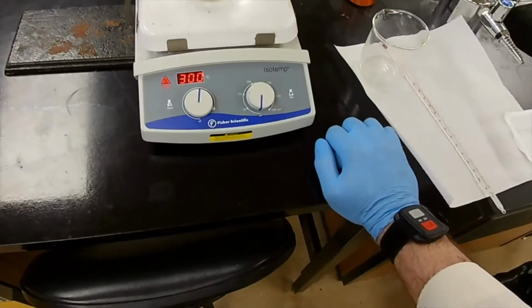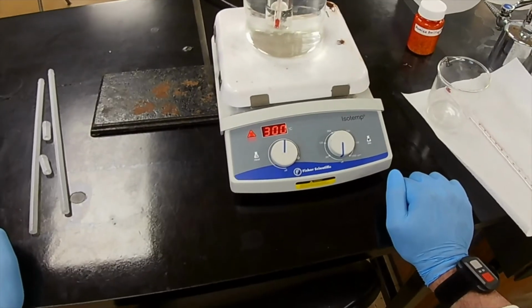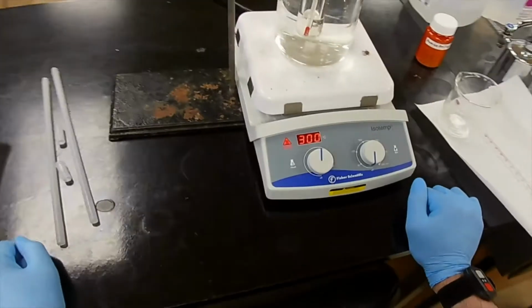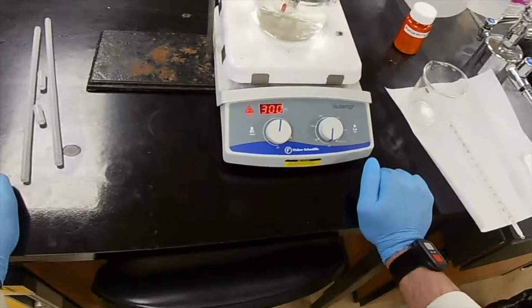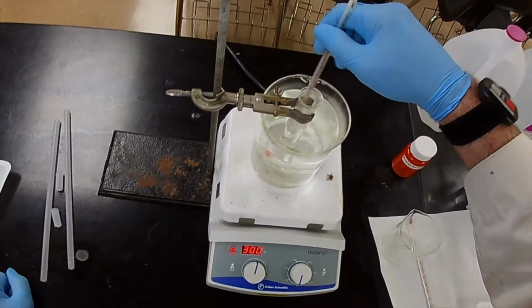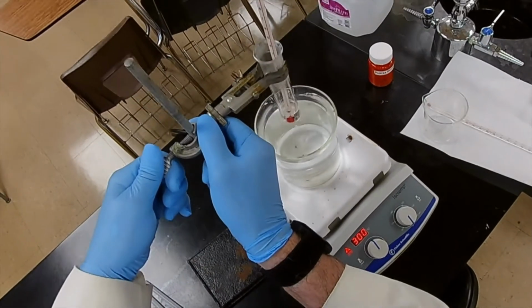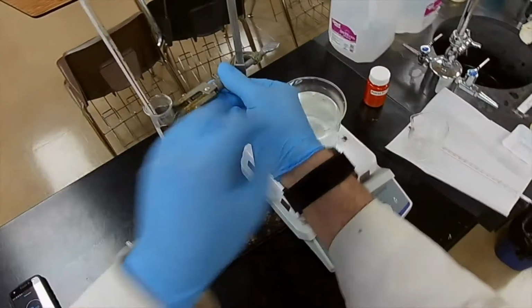And you may be able to see, have to get the right angle, those little pumice chips are dancing around on the bottom of the beaker. That's because they're providing a nucleation source for the boiling water, making very small bubbles instead of one big one. Okay, I think we're all done. We can come out of the water now. Out of the water bath. Let's see. And swing it around away from the heat source. In fact, we can turn the heat off.